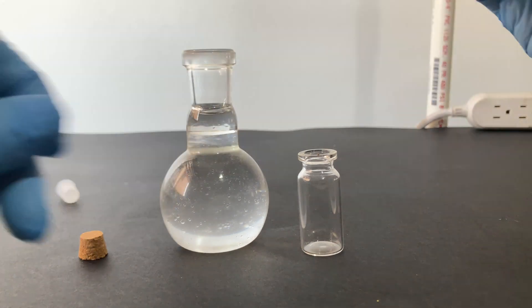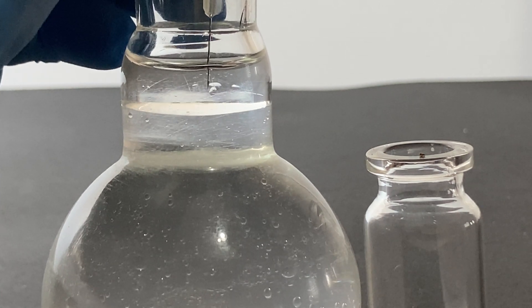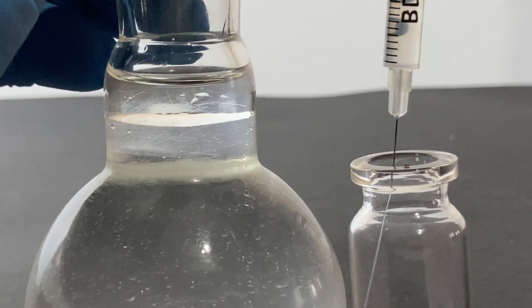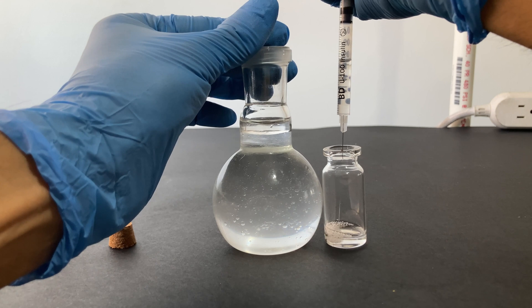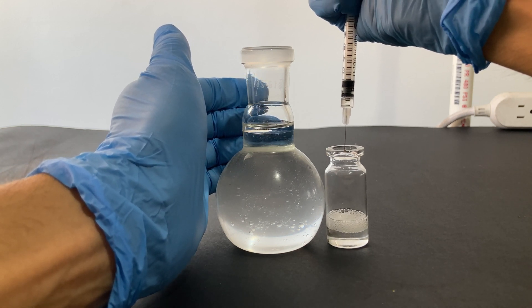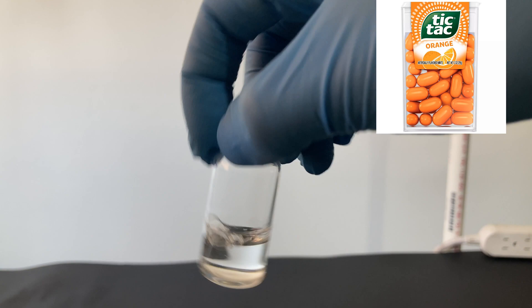To separate the oil from the aqueous phase, you could use a separation funnel. However, I tried with a syringe. I had to do it several times to recover everything, and the syringe was getting stuck because the limonene was dissolving the rubber inside it. But I could separate the layers with no issue — you just need to be careful not to take any water with the oil. At the end, I was able to obtain around 3 ml of limonene oil, which represents a yield of 16 ml per kilogram of orange peels. This made me think that what I got was not completely pure, but its smell and appearance matched with those of limonene oil. And I swear, this smells like those Tic Tac candies that I love — maybe I should try to make those in the future.